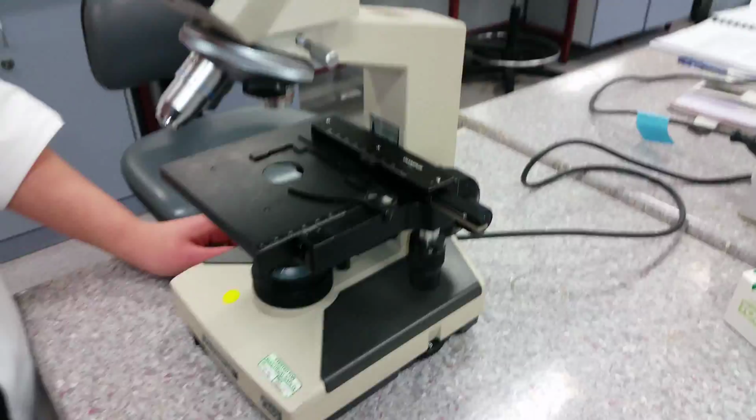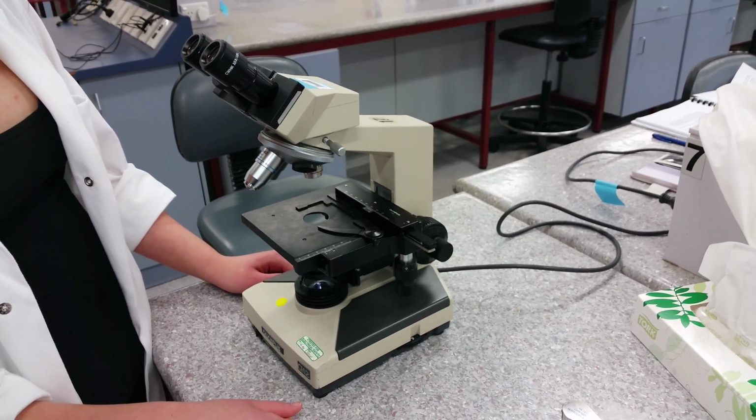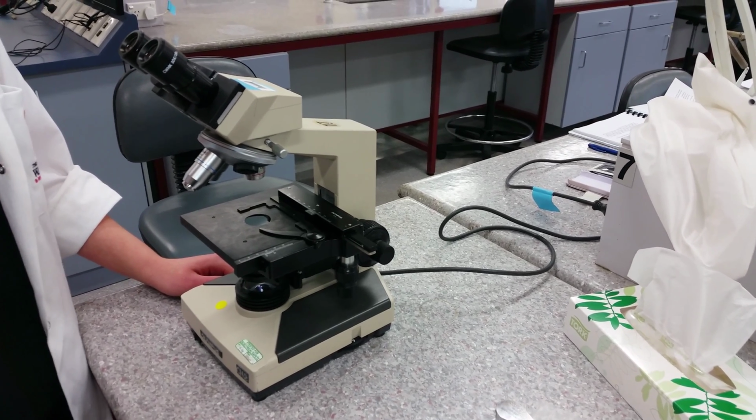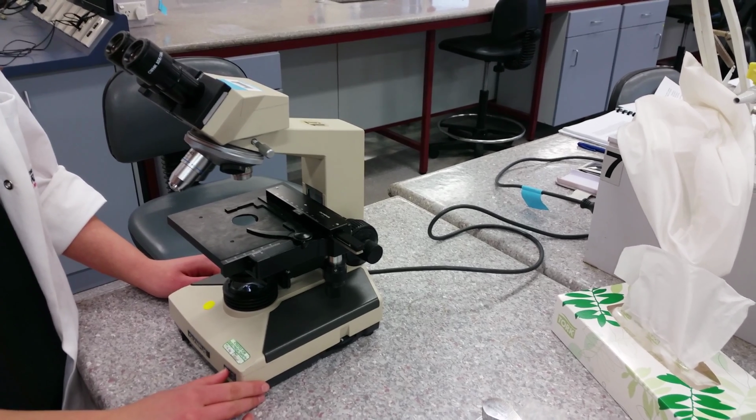Learning objectives from this video include basic care, the major components, their uses and functions, and how to magnify your specimen without stuffing it up or annoying your supervisor. Terms like focus and resolution will also be introduced.